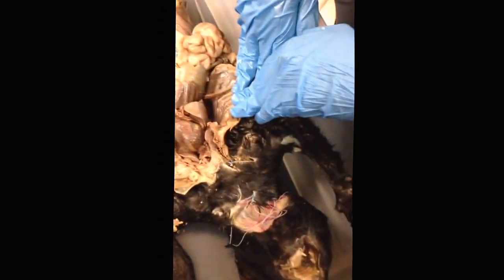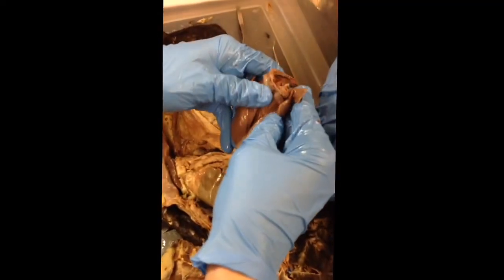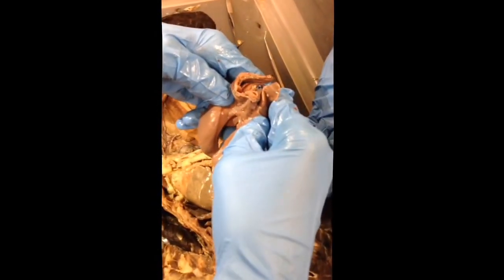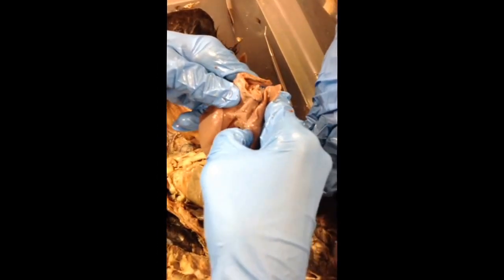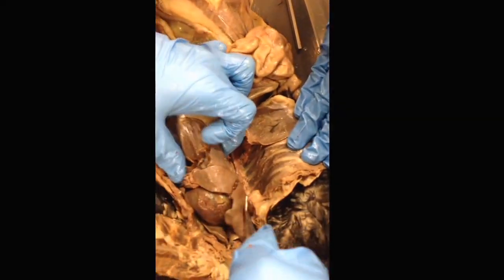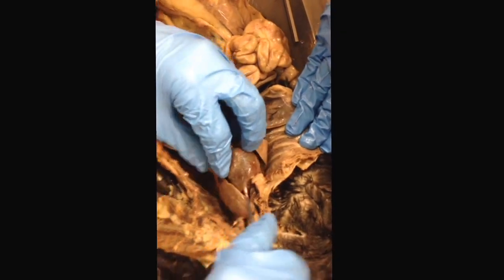The next thing on the list is the bronchus. It's harder to see on the cat, but it's a little bit easier to see on the separated pig heart. You can see it's where the one tube of the trachea splits into the two tubes of the individual lungs, and those individual tubes leading to the lungs are the bronchi. Next thing on the list is the lungs, and that's pretty obvious. You can see that on the cat here. It's the two separate masses on either side of the heart.